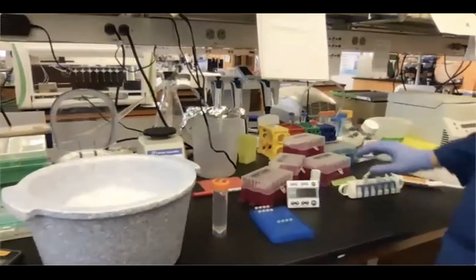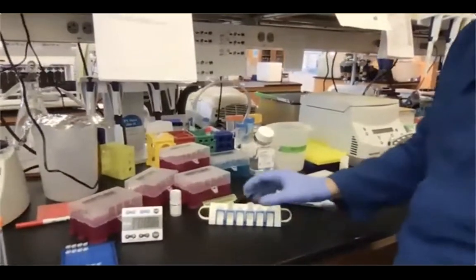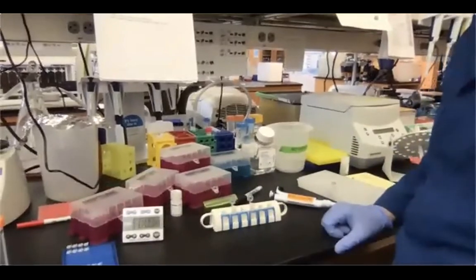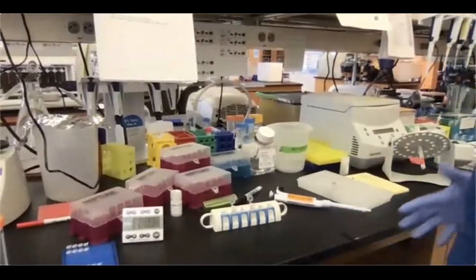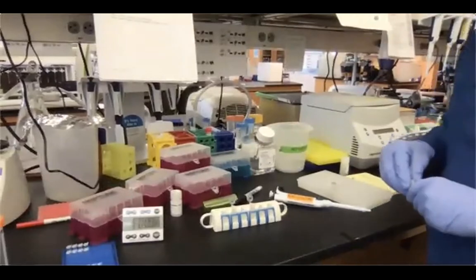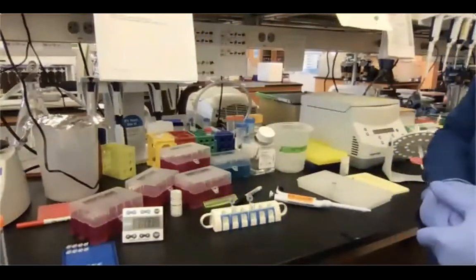If you remember, the final separation occurs very rapidly. So in a matter of like 30 seconds, the beads are already pelleted against the magnet. So I am able to transfer my eluted DNA into new tubes, and then we are going to check the size distribution on the TapeStation and the concentration with the Qubit instrument.